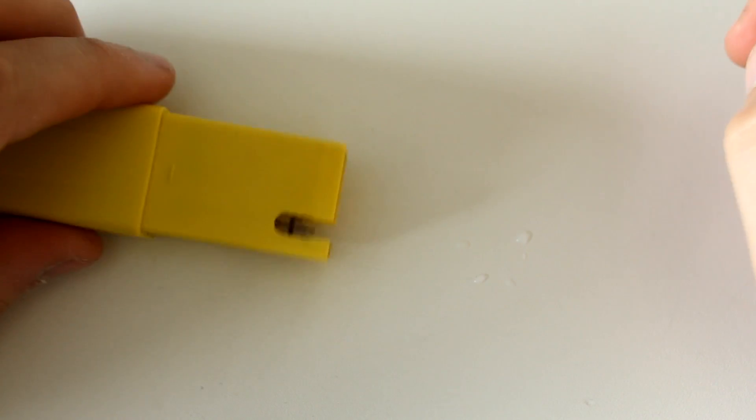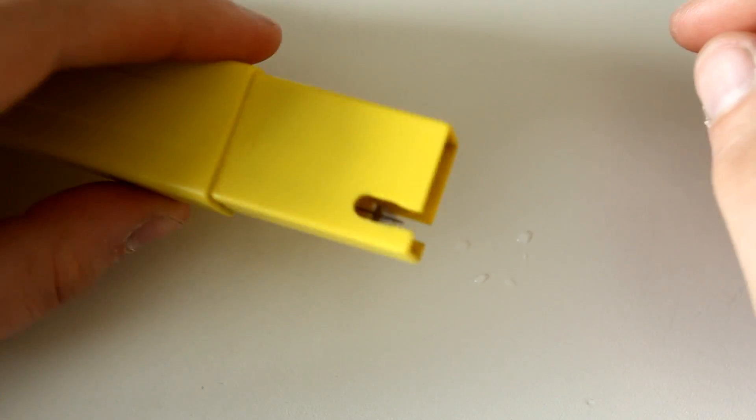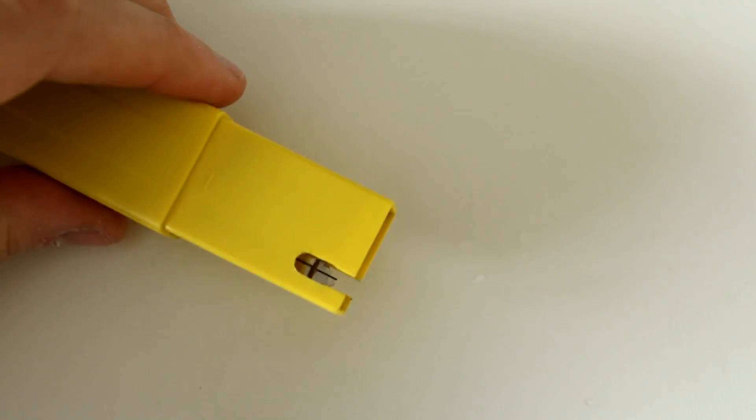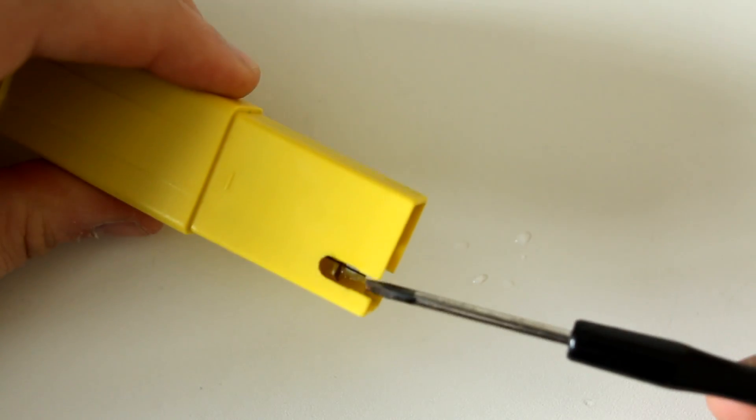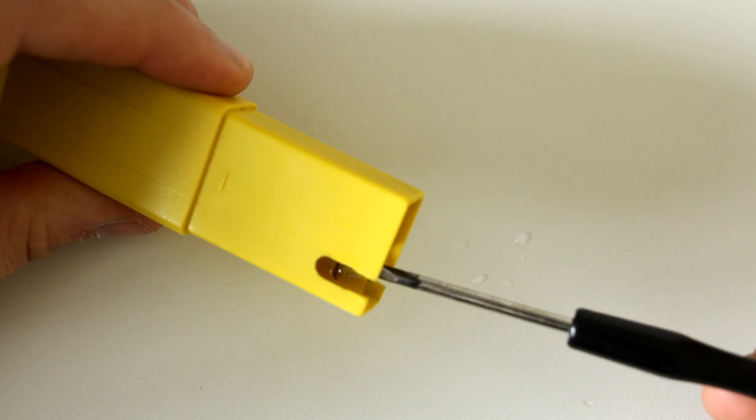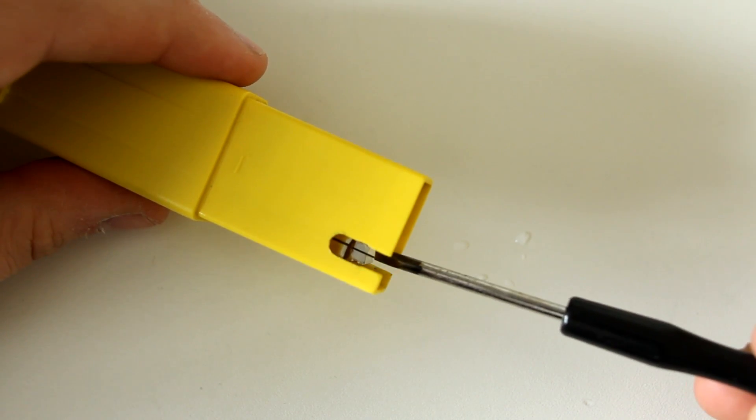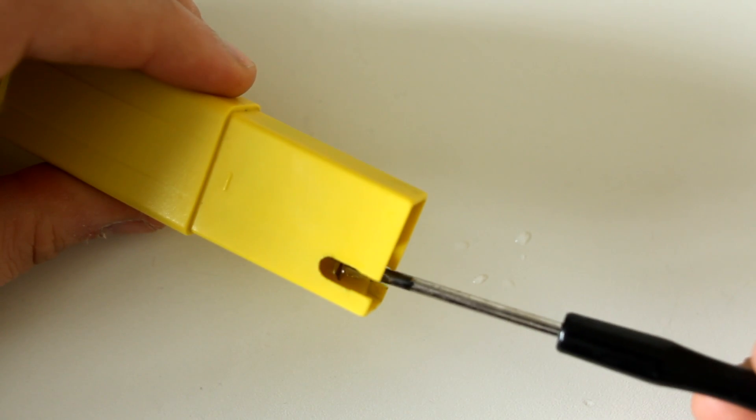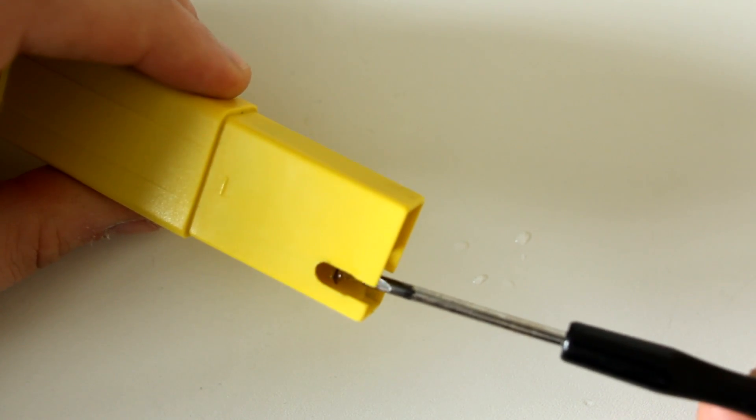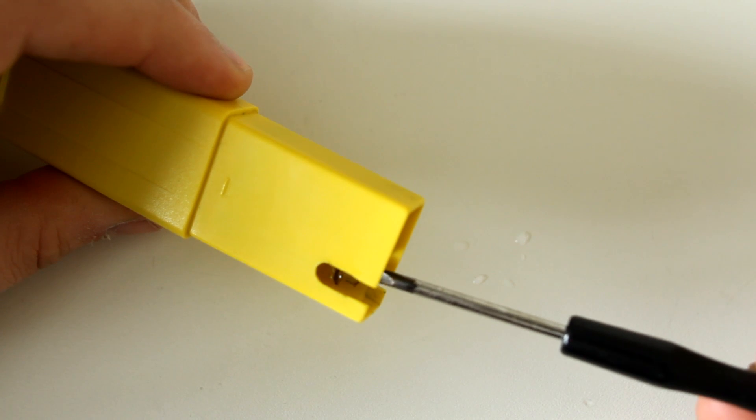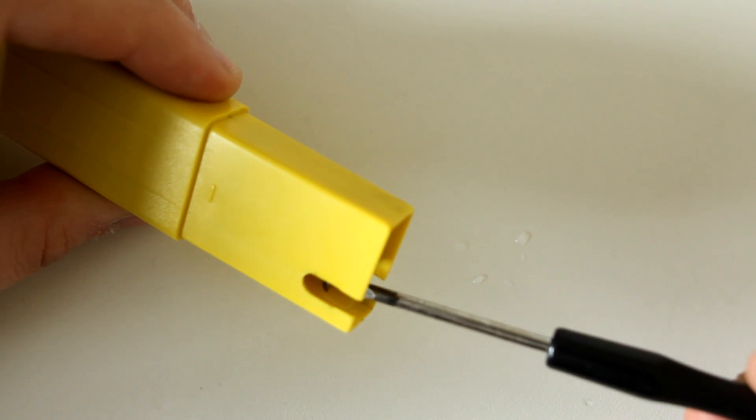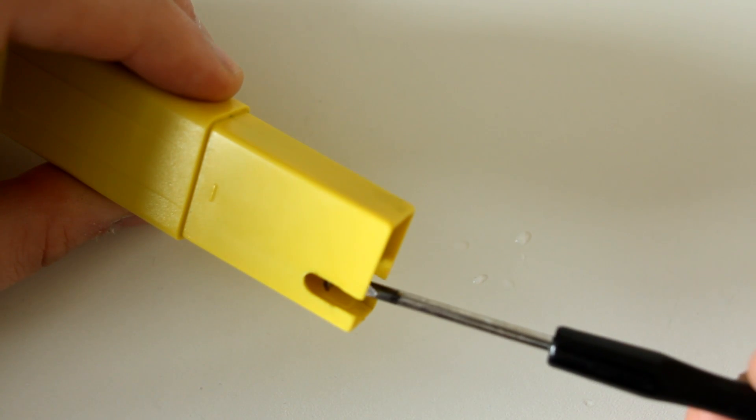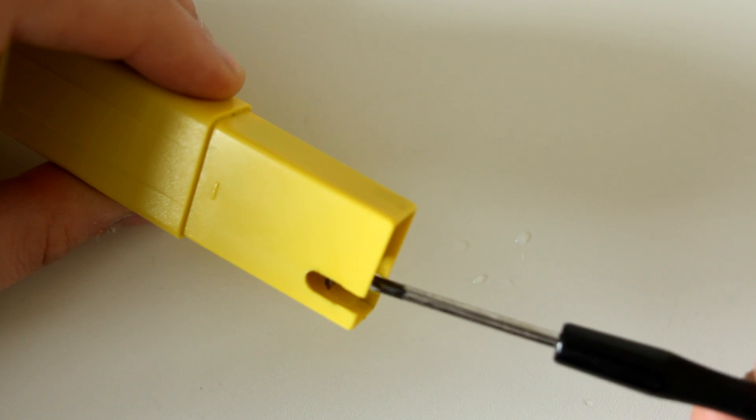Well, I definitely broke it. There's a little glass bulb here with a pin in it - this is the sensor part. I don't know how this works, but I broke the glass bulb, so I think this is now not functional anymore.